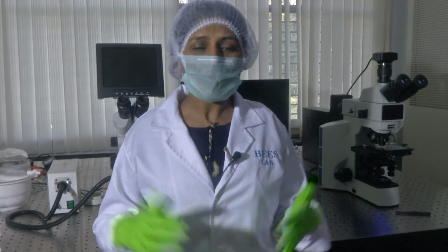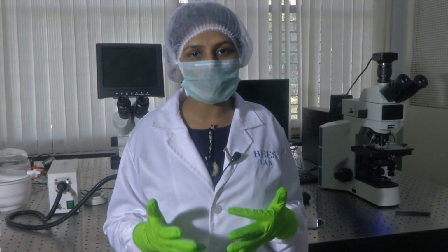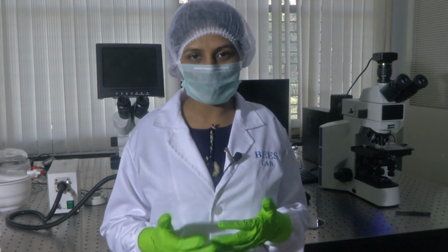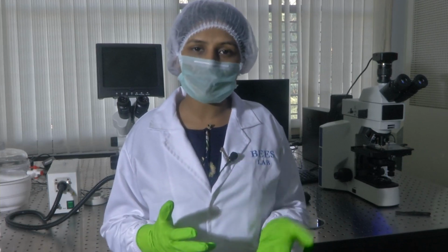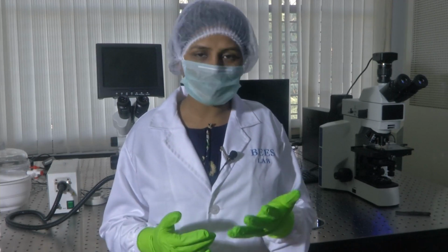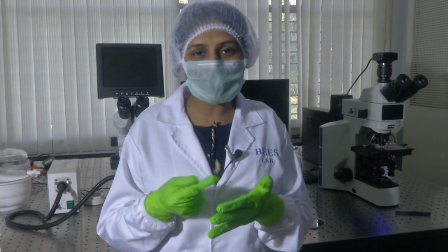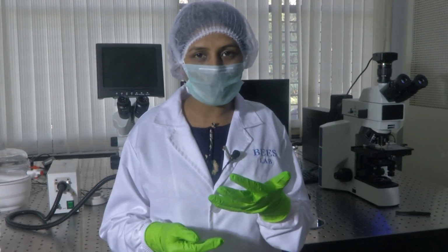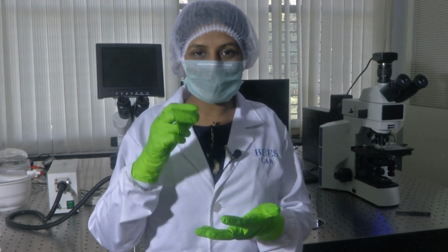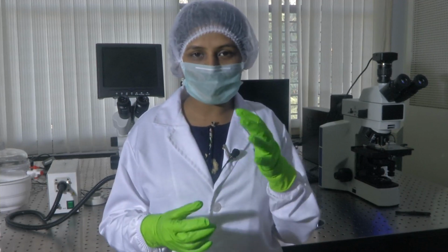And then one of the basic types of microscope, which is available in most laboratory facilities, is the stereo microscope. How is it different? I am sure everybody has heard about the compound microscope. When you were studying in your intermediate, you used thin slices: you took an onion, cut it into thin slices, kept it under the compound microscope and understood the features of the sample. All of that requires slicing and then understanding the features.